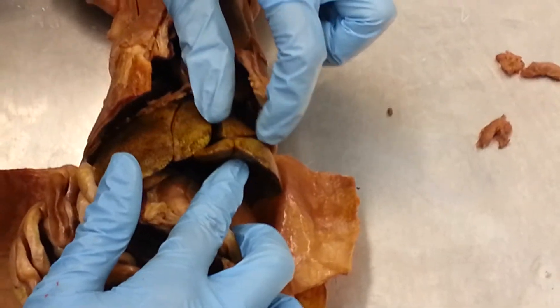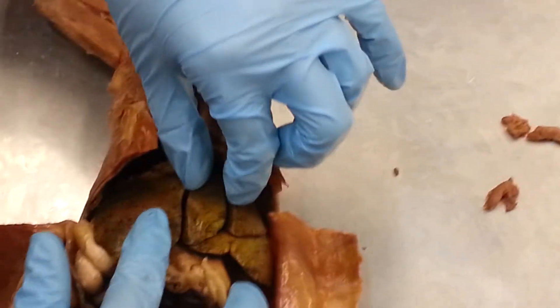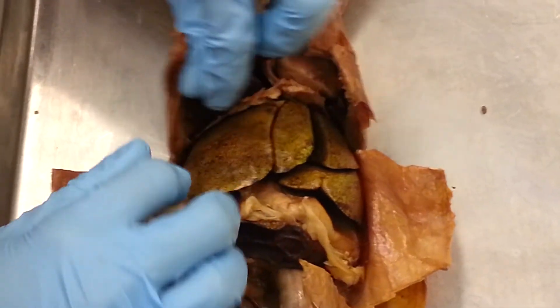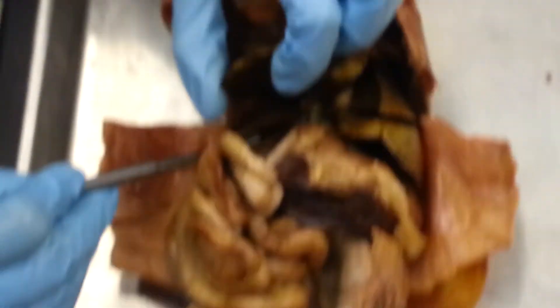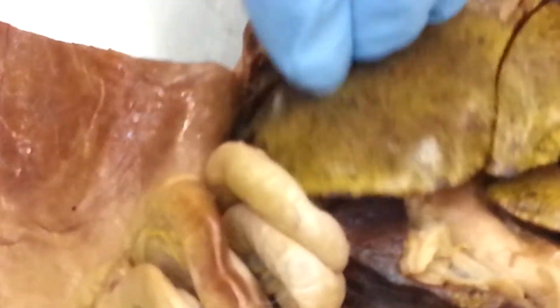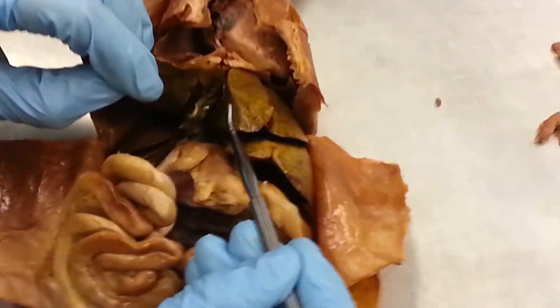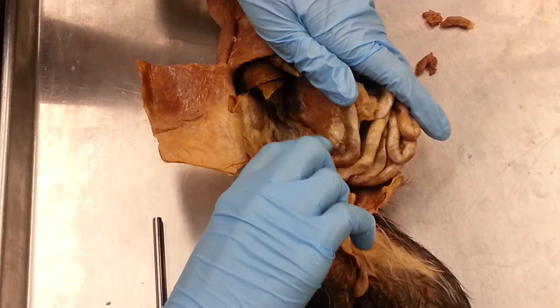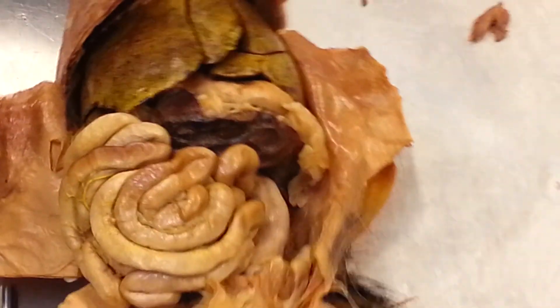This is the left lateral lobe of the liver. This is the left medial lobe. This is the quadrate lobe. This is the right medial lobe. This down here is the right lateral lobe. And then this one is the caudate lobe. The gallbladder is in there. The pancreas is in this fold of small intestine. And then the spleen is right here.